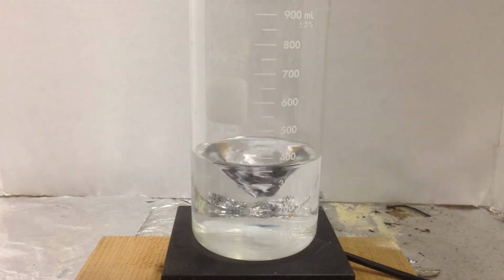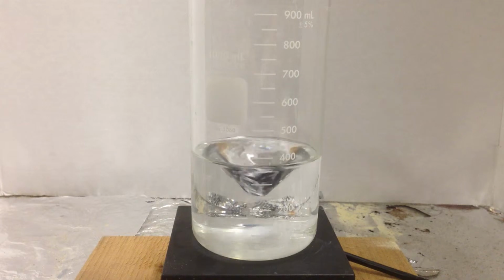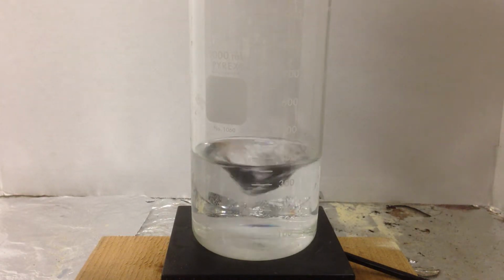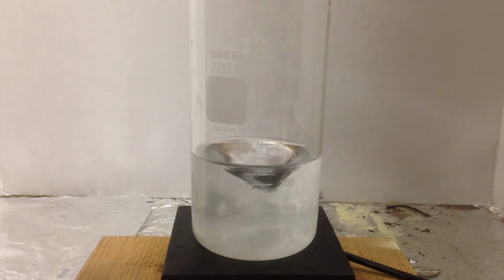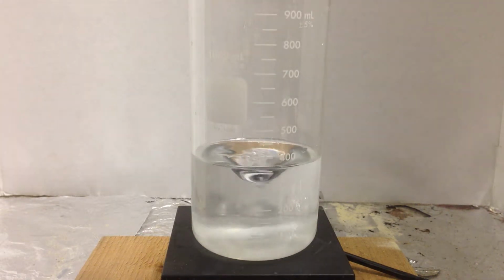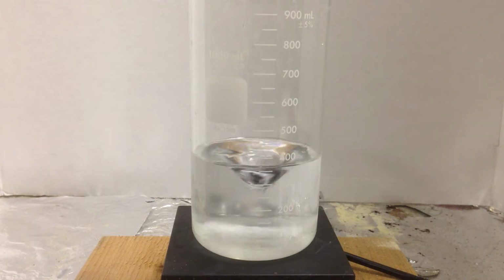I'm going to take some aluminum nitrate. With this chemical, I'm essentially making some free aluminum ions. So I'm going to take some aluminum nitrate and dissolve it first in this beaker. So I'm going to drop in aluminum nitrate. And as you know, the solubility of nitrates is very high, so this is going to dissolve very readily.